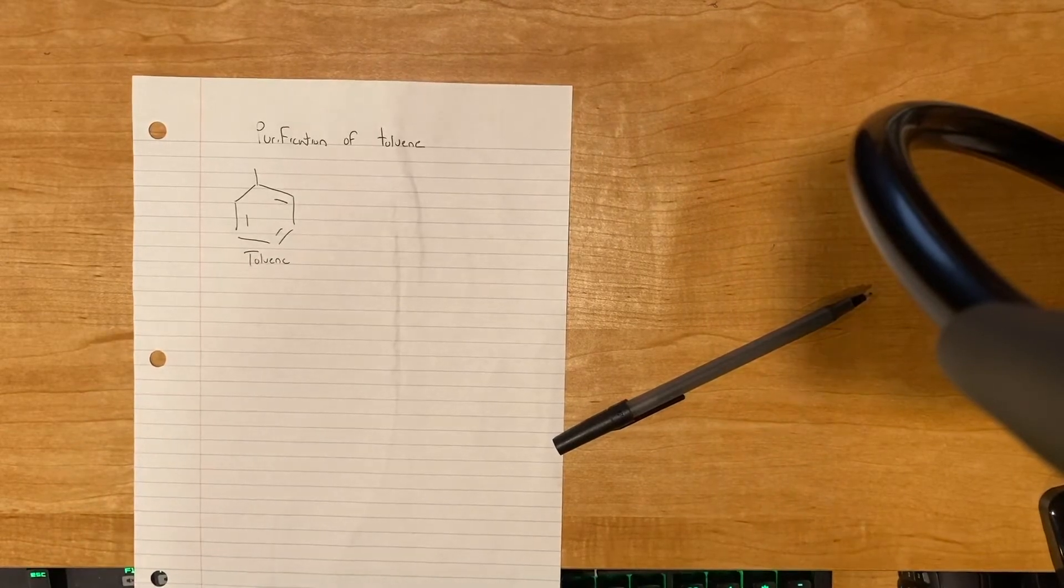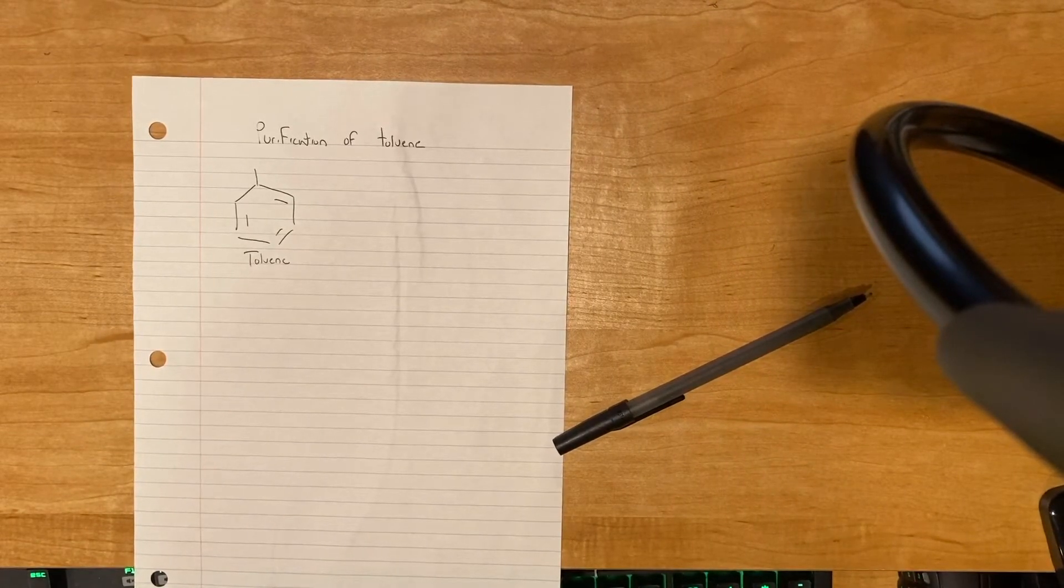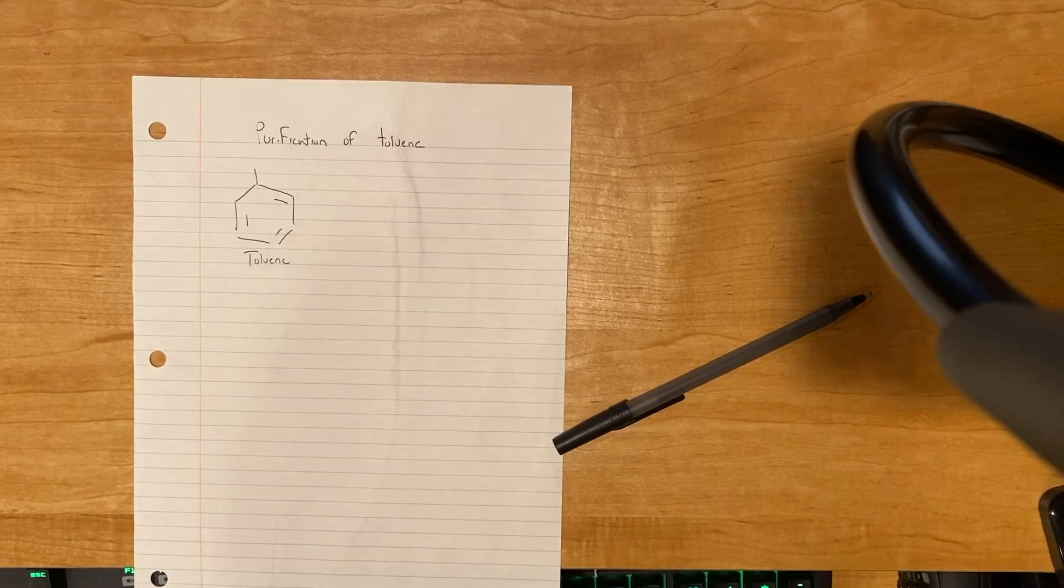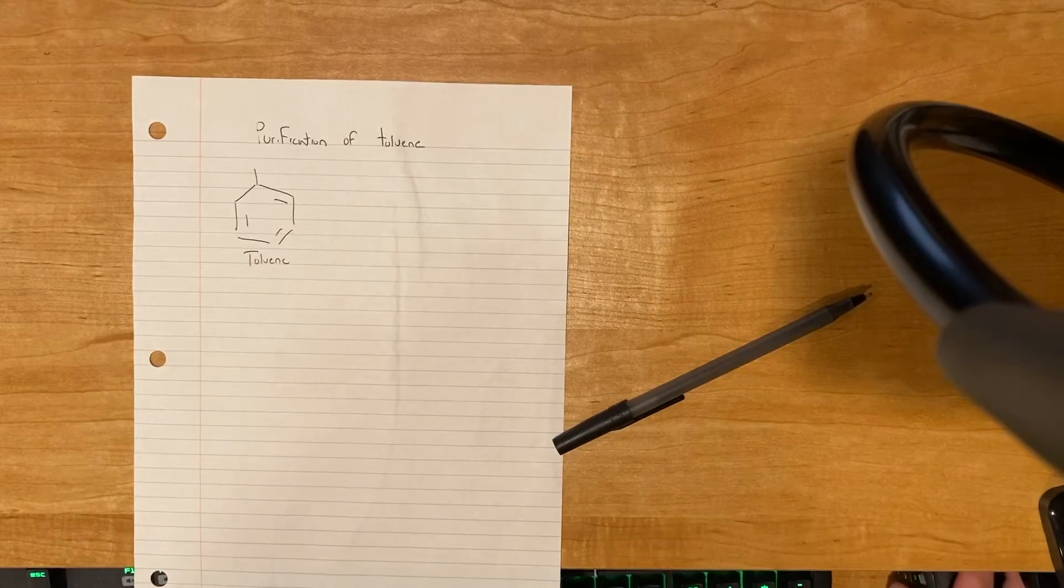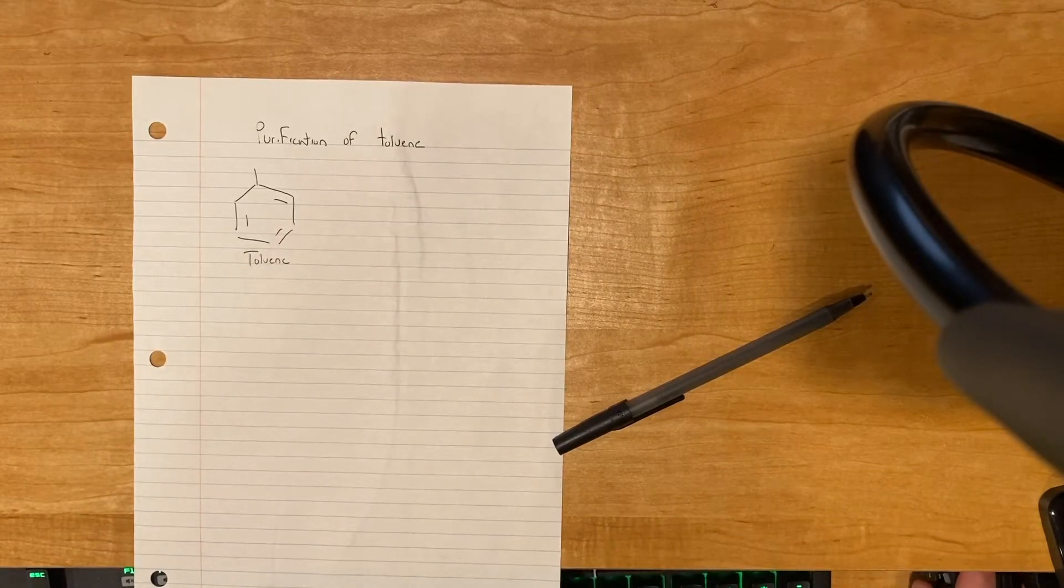Hello everyone! Today for my first video, we'll be covering the purification of toluene following the procedure done by Doug's Labs on YouTube. Toluene is commonly used in many laboratories as an organic solvent due to its lack of polarity or as a reagent.